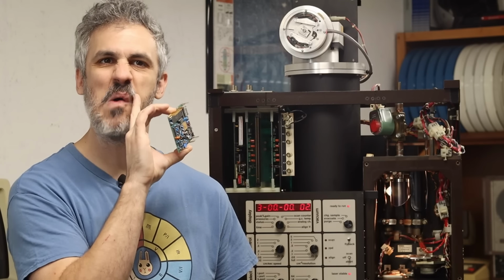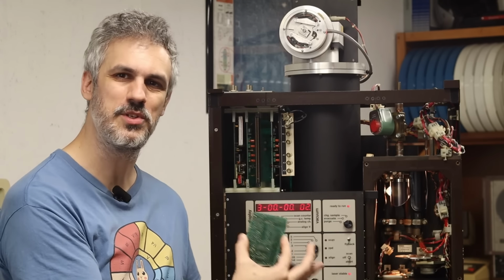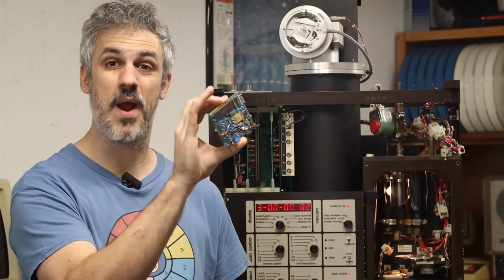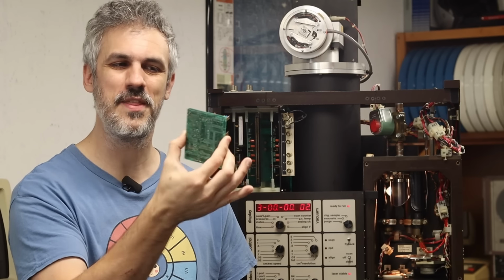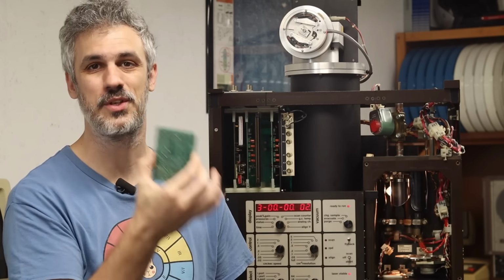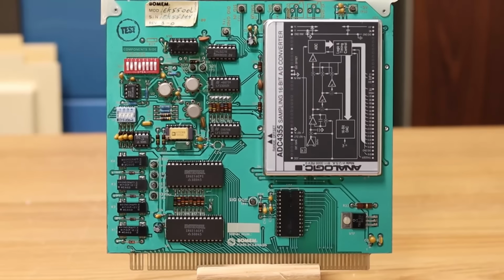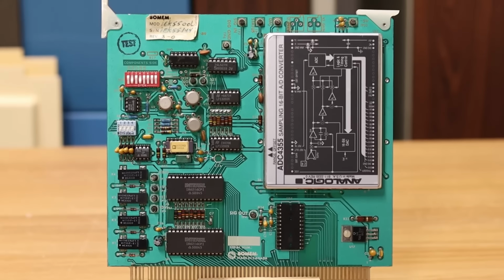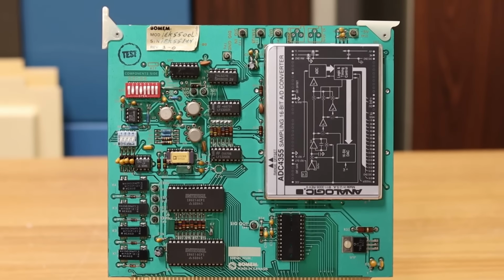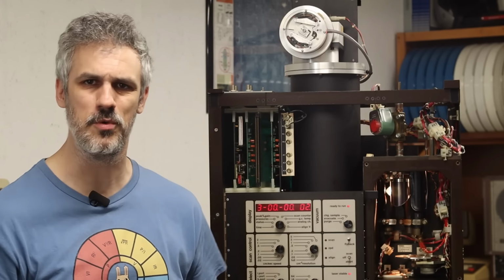But well, I say it seems to be working all right. We don't actually know, because enough of my machine isn't functional to properly test this. So one thing that I want to do today is give this a test and see how it's going. And if we have ruined this by cracking it open, Mike sent me down an extra ADC in there so that we can continue on with the build. However, there is one more thing that is still very wrong with this machine, and that is the moving mirror.